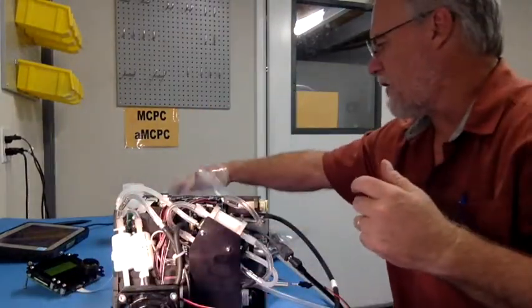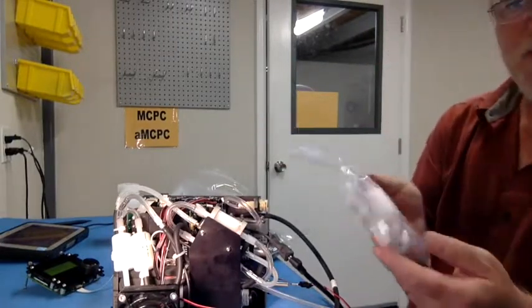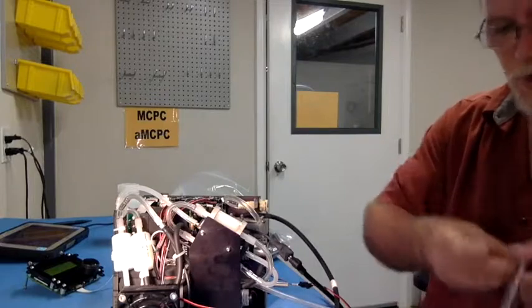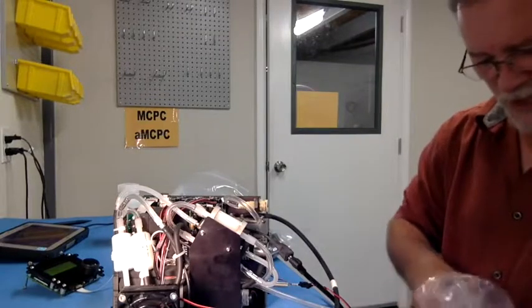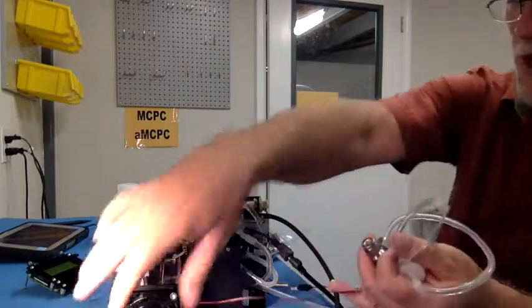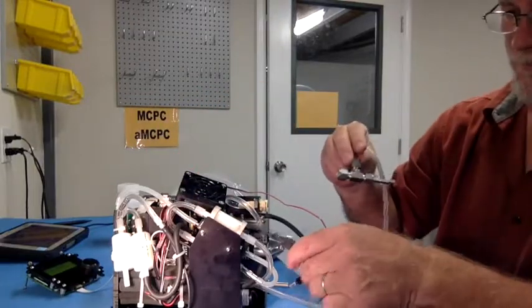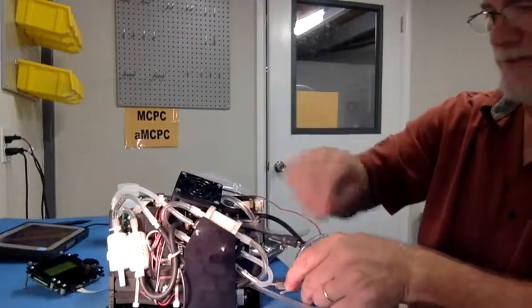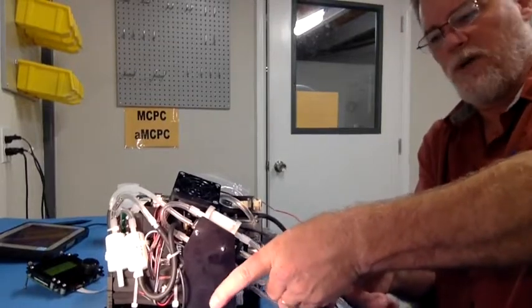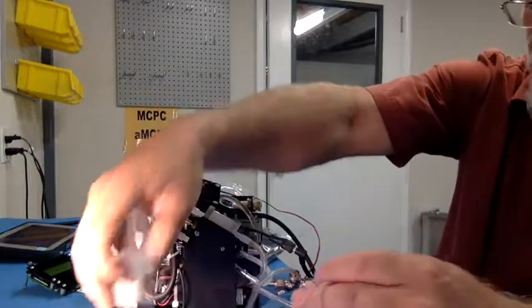So let me show you a few other things that we have in the ship kit. This assembly is what we call our saturator bypass. And what that means is, let me show you, you can actually install this Swagelok T, I'll just leave this up here, on the inlet, like this, okay? It should come with nylon ferrules, so you're not going to crimp on the stainless tube and permanently install the ferrules.